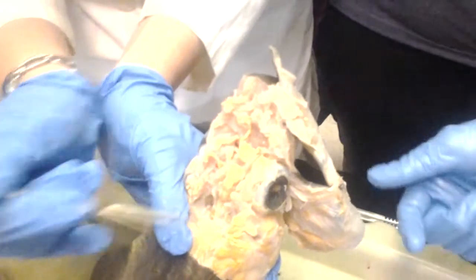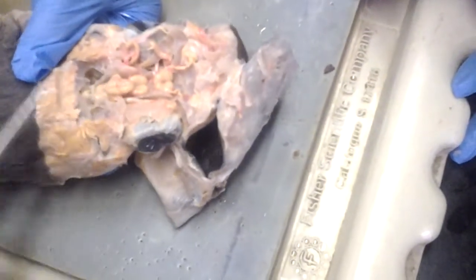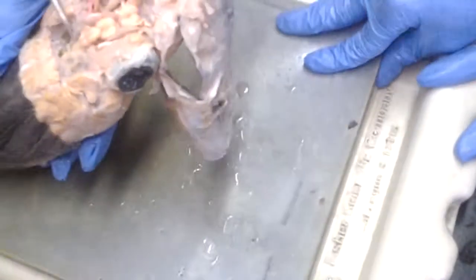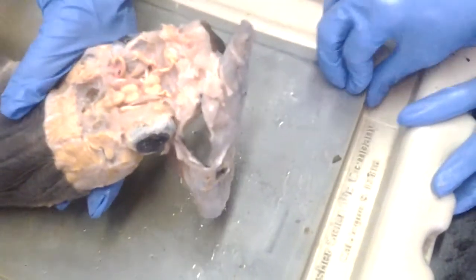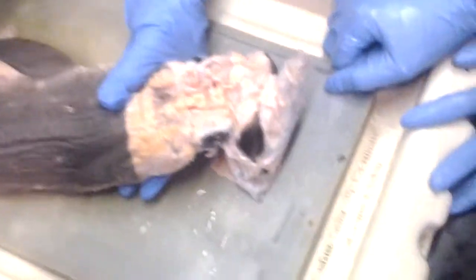So it's not just in the center. It's the whole thing. Everything down from here is the medulla oblongata, the myelencephalon. And we can write the auricles on the sides, laterally. Can you repeat all that once? Just a moment. I have to move ahead a little bit for them, but I'll come back to it.